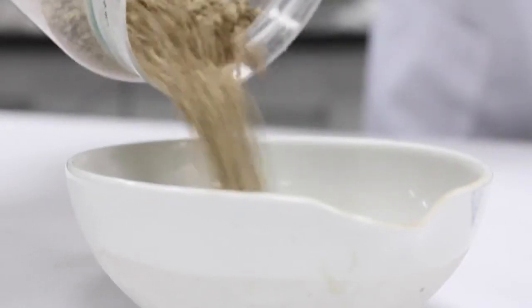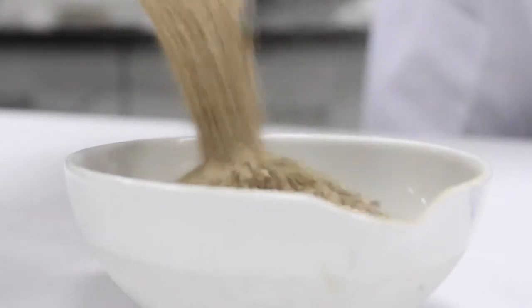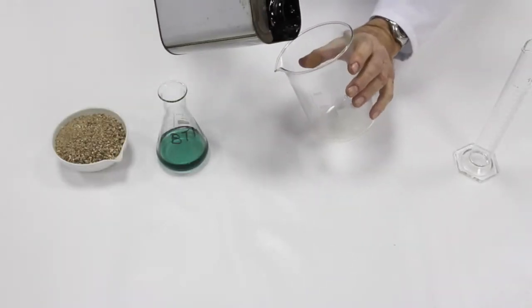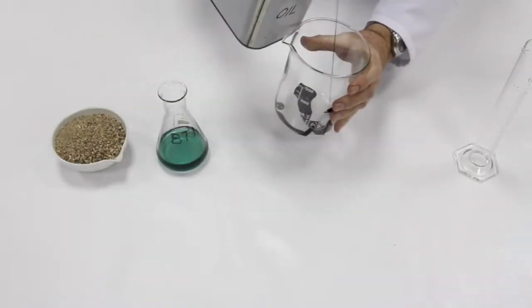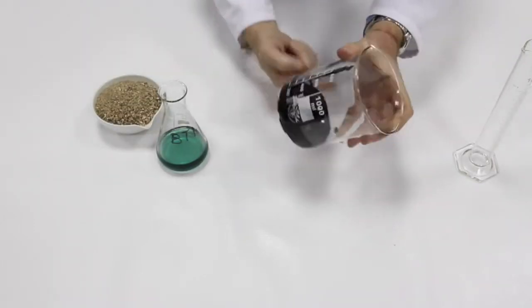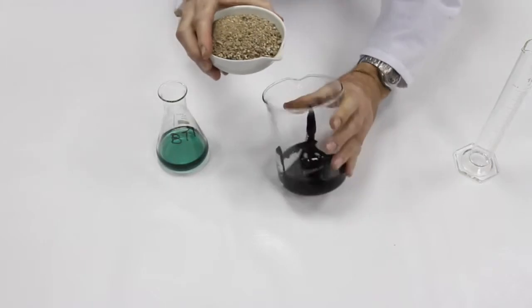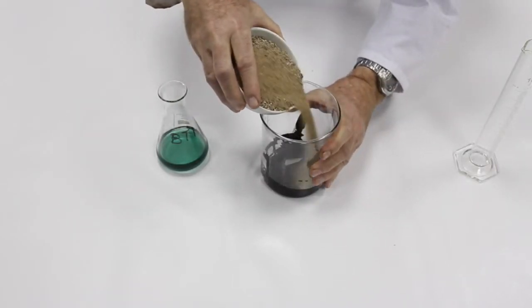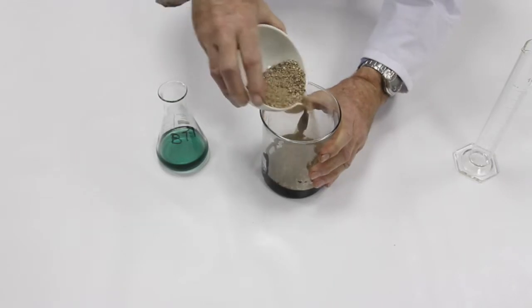Here, we will simulate crude oil recovery in one type of ground soil. The lab technician pours a sample of crude oil into the beaker and also stains the beaker's walls to illustrate the effectiveness of this cleaning product. The lab technician pours sand into the beaker. The sand and crude oil is mixed so that the entire mass is uniformly homogenized and impregnated, as well as the walls of the beaker.